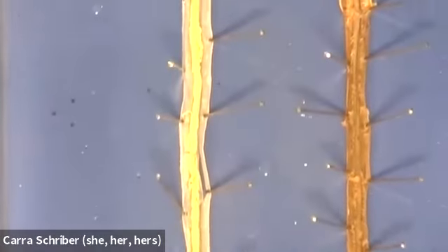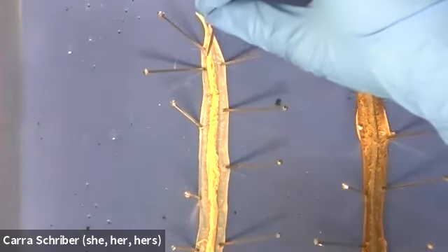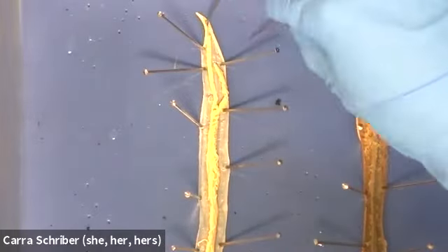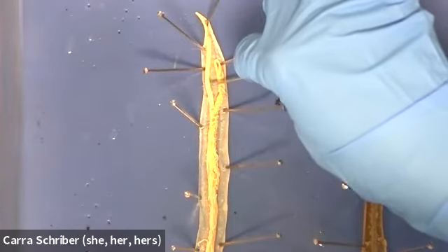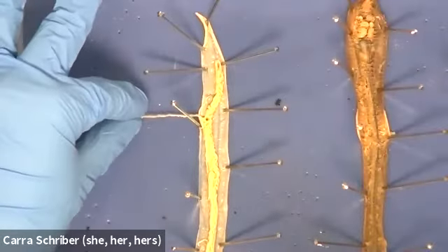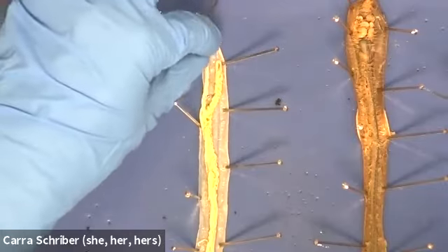And the organs here, you would think that this really large coily thing is the intestines because the intestines are pretty important, but nope. Actually, this very thin ribbon, which I'm going to pull out for you, underneath all of the coily stuff, I'm going to pull it to the side so you can see how thin it is. That thin, thin, thin ribbon is going to be the digestive tract.